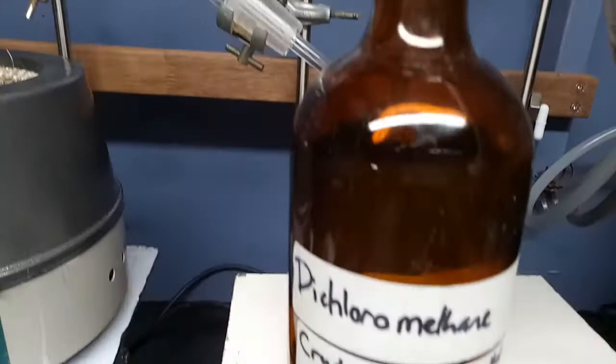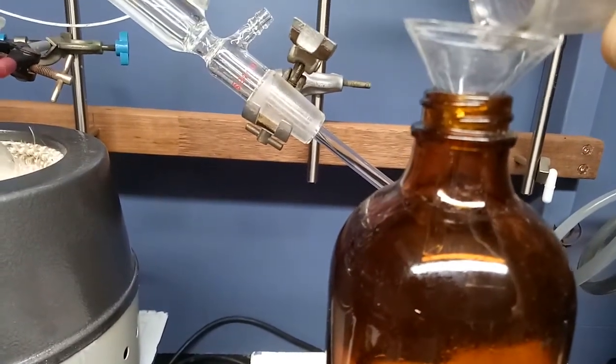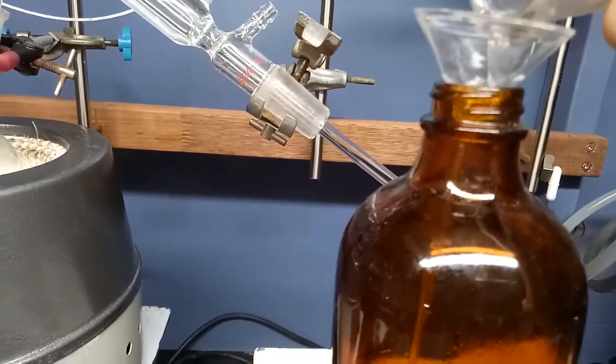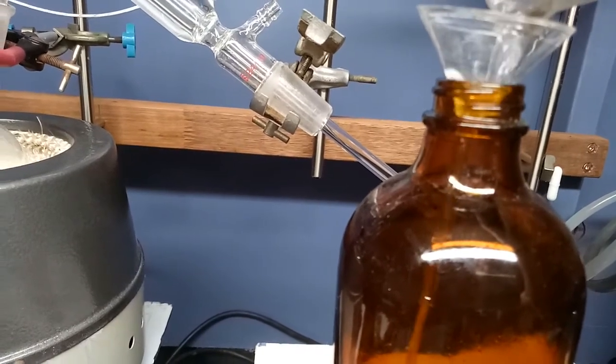Here's the recovery of the dichloromethane. It's a bit crude. It contains some methanol and probably some water as well. I distilled it the previous day from some paint stripper.